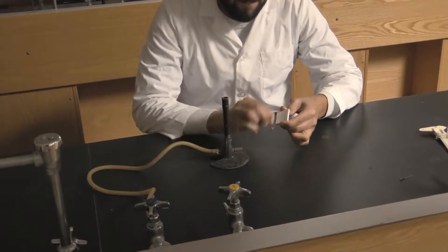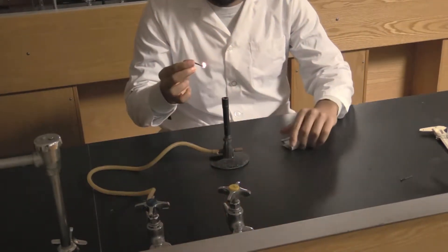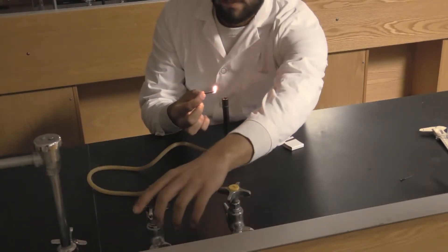One of the heating devices that you may encounter in your lab is the Bunsen burner. Solem will help us in this demonstration. This device uses the combustion of natural gas to heat things.